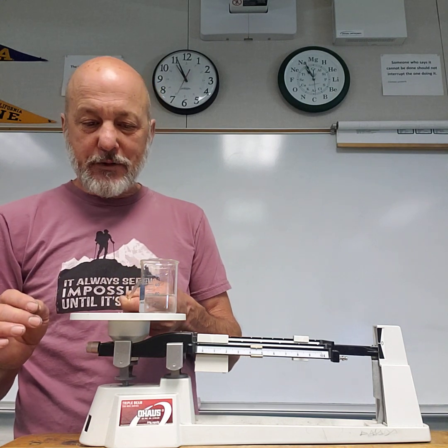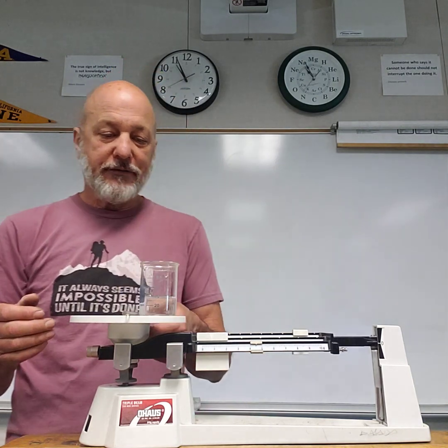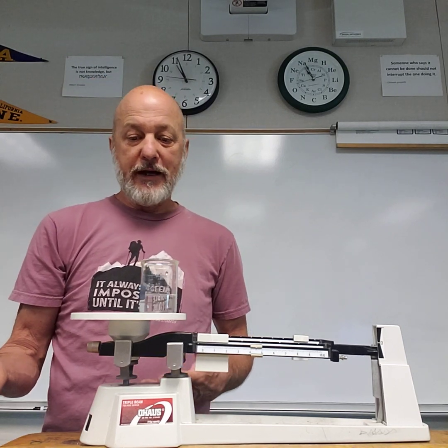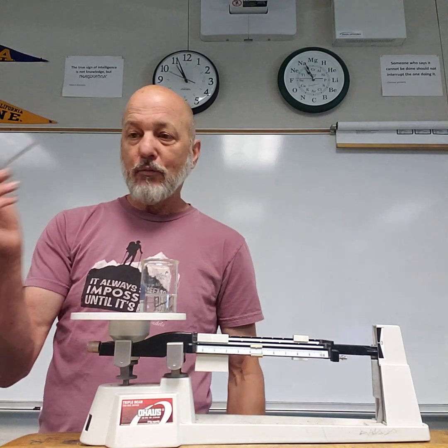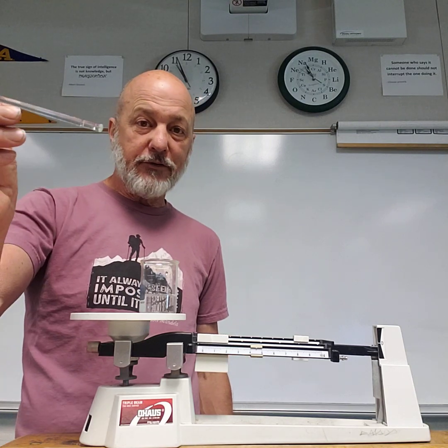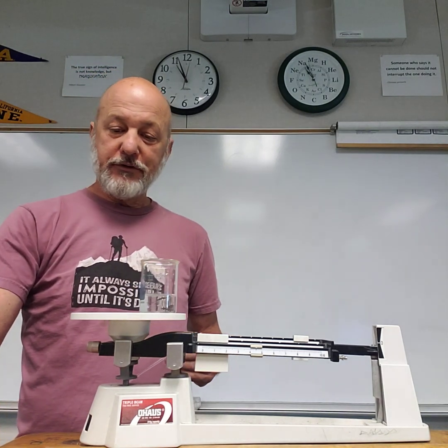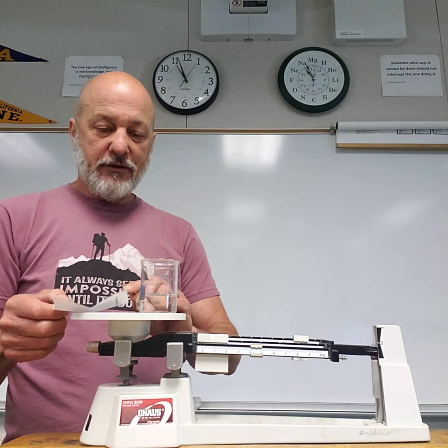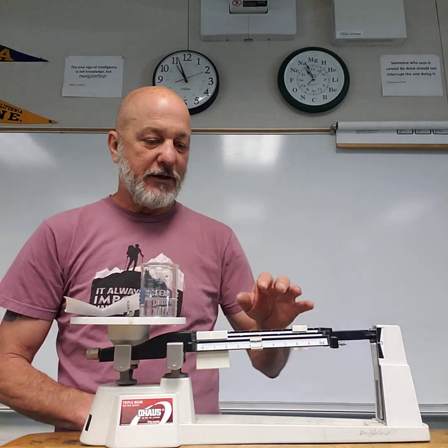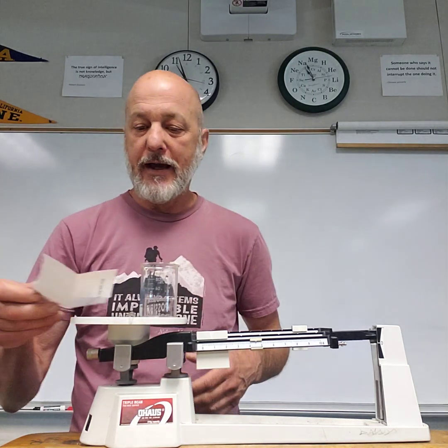Now, the reason I had you weigh the stir rod is because the stir rod has some droplets on it. If I had just done this, stirred, and had not weighed the stir rod before or after, I would have lost some mass, the mass of the water on this. So we want to be sensitive enough with our scale measurements that we could say, oops, I think we lost some water in this process, or we lost some sugar particles or something. And of course, if you don't put the paper back on the scale, you're going to have a huge change in mass, the mass of the paper that's not there. So all of this is just confirming our lab procedures, and then you'll get the mass afterwards. What happened, and we'll work with a particle model on that.